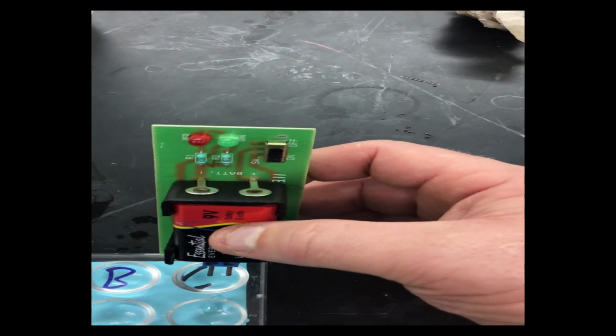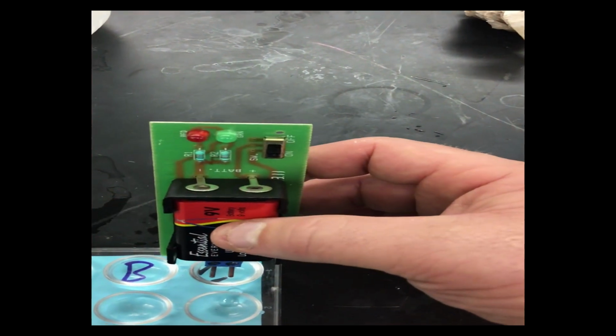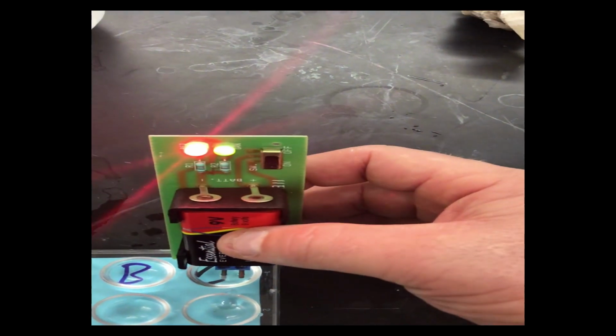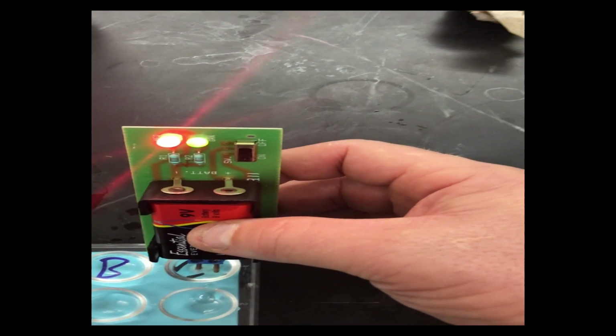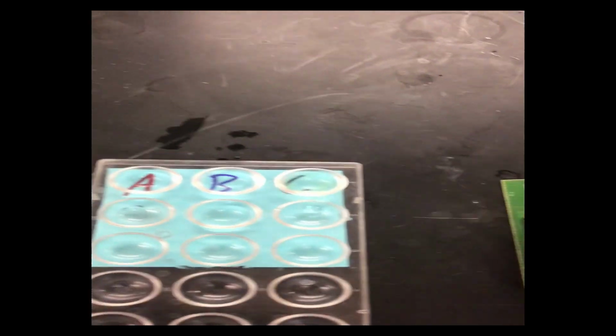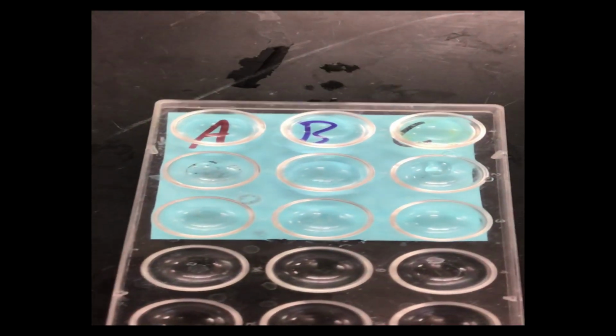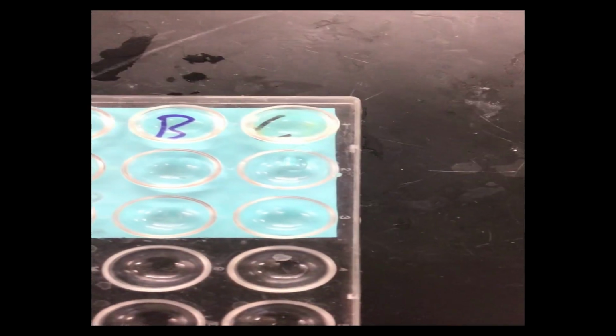Then we come over to C, and whoa, there we go. So we see a major change in conduction for C. So both the red light and the green light coming on very strong, so we're showing a lot of conduction for C, okay? So from that, we can conclude that A and B, even though they dissolve in water, are non-conductors, where C was creating conduction.